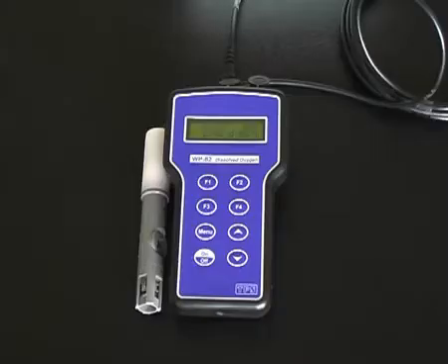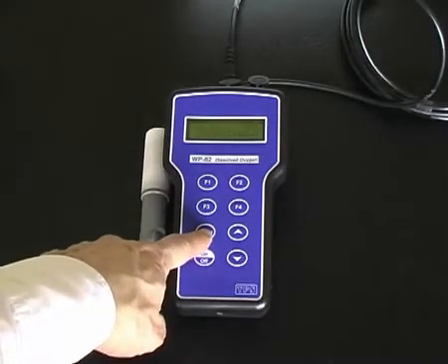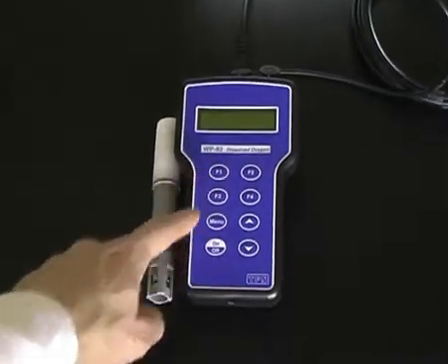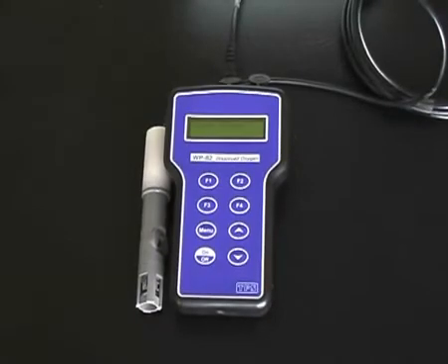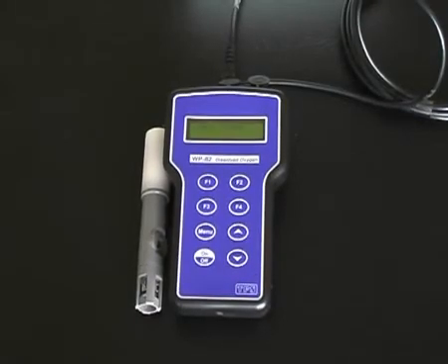To calibrate the TPS WP82Y, the procedure is the same for the 90FLT. Press menu, F1 for cal, and press F1 to calibrate instead of pressing enter.